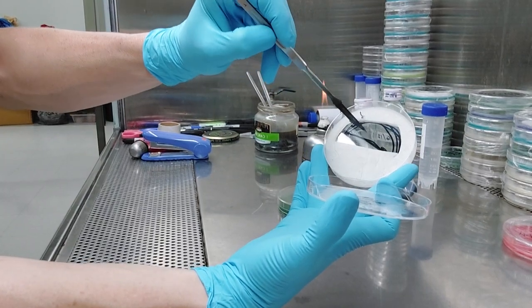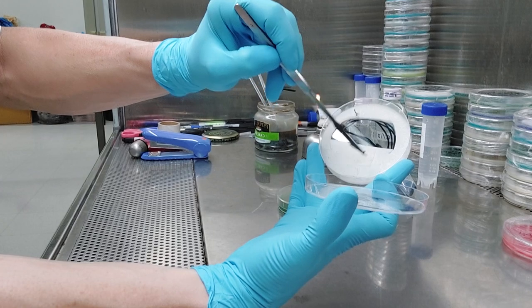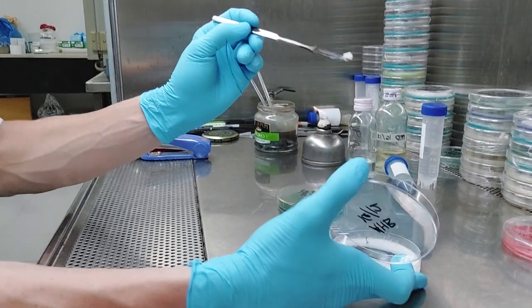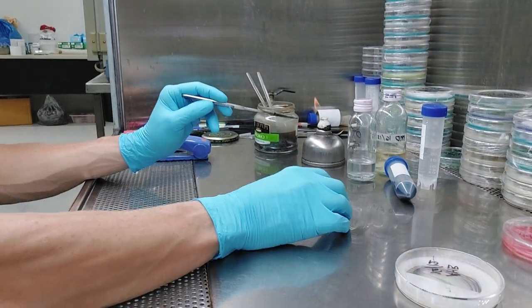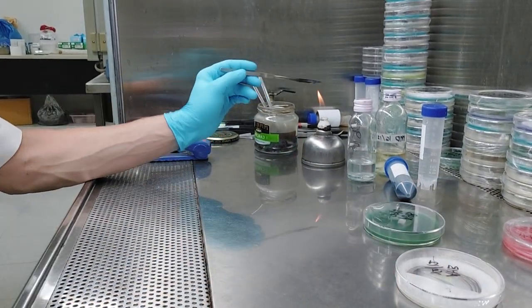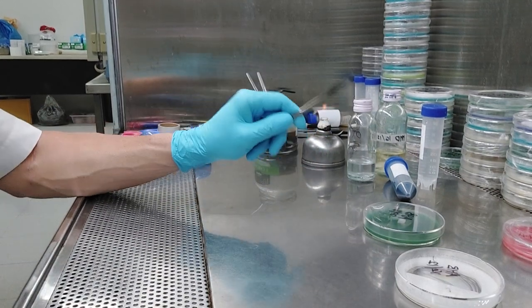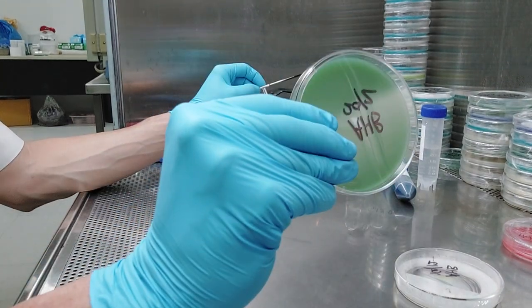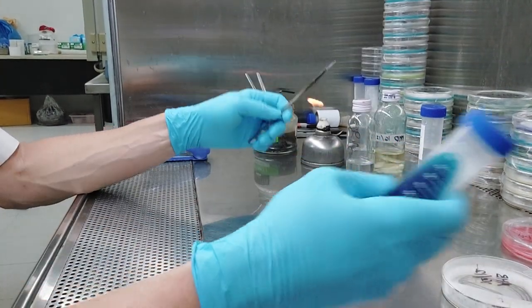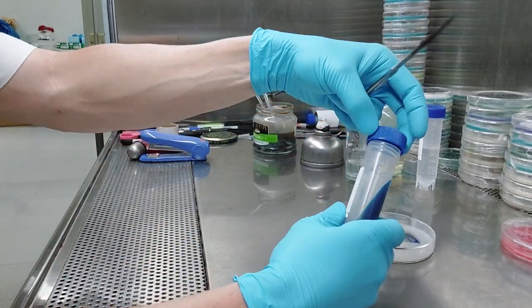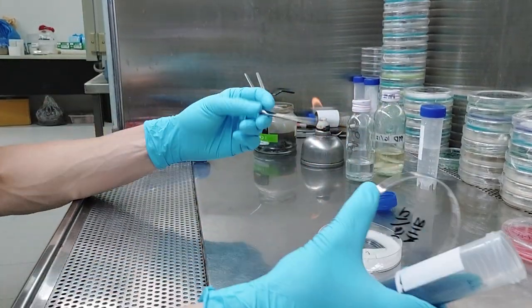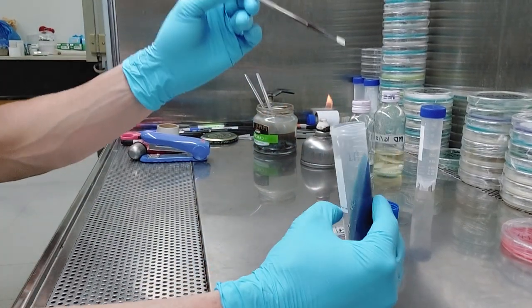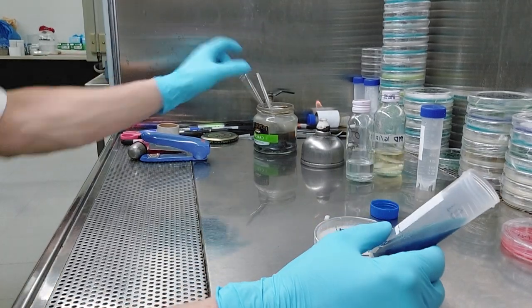And then I'm going to go back here and make more cuts because a little tiny piece. I don't need much. I don't want to really be using my scalpel, and I'm flaming my scalpel again because I'm talking. There's so much stuff that flies out of your mouth. So you guys, yeah, I've done my sub already. That's done. How about long-term storage? Don't touch the rim. Go in here. I dropped a piece. Just put it sort of on the side. Might fall down.